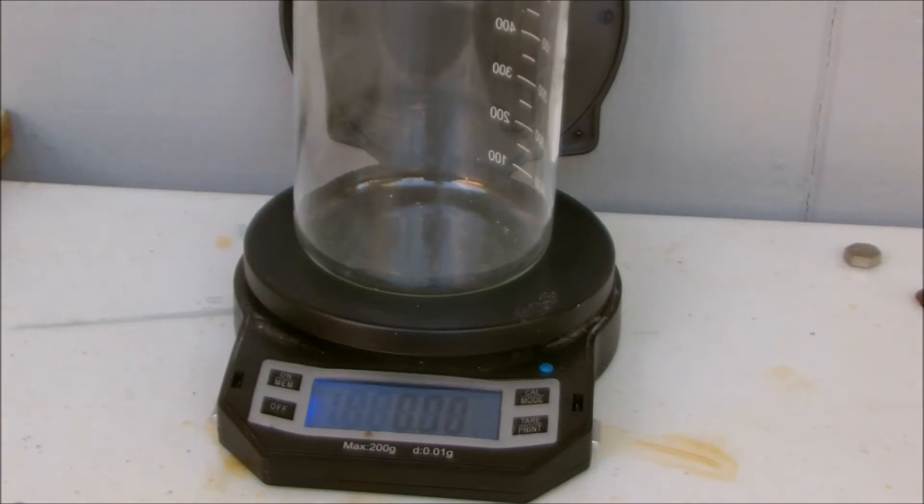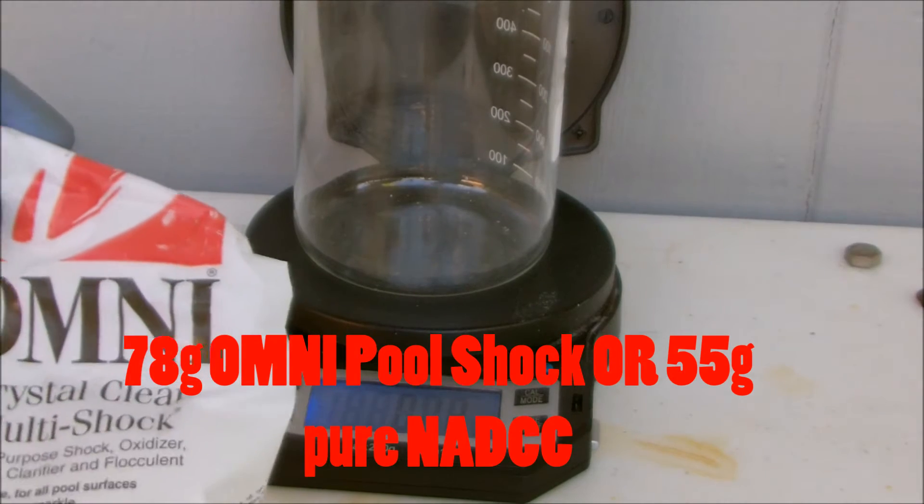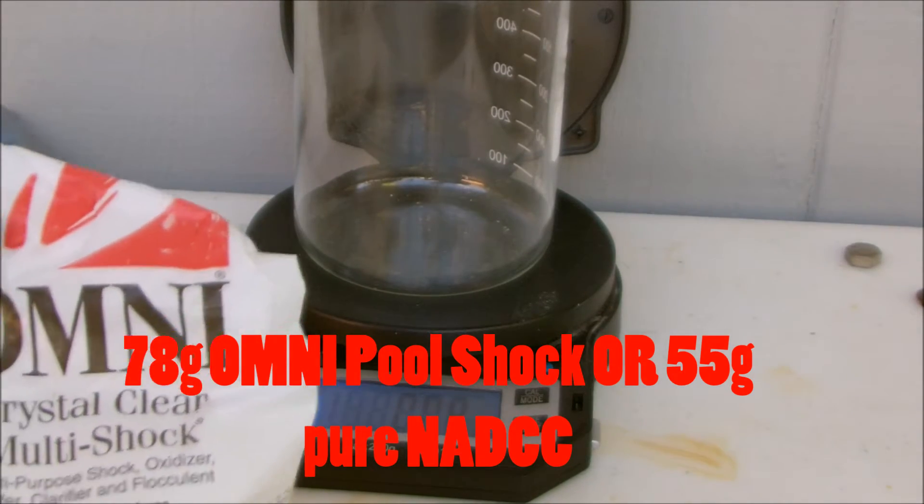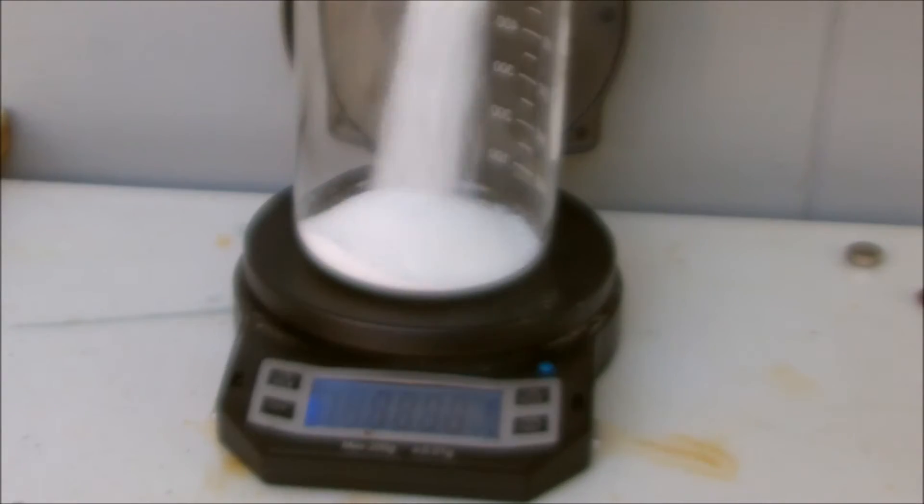Next, I'm going to weigh out 78 grams of Omni Crystal Clear Multi-Shock. There we go.